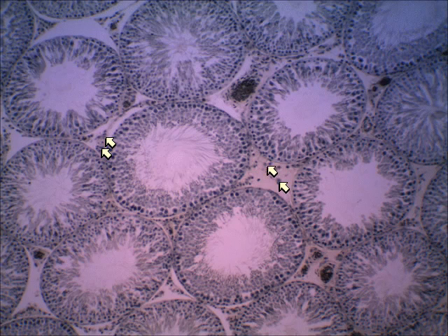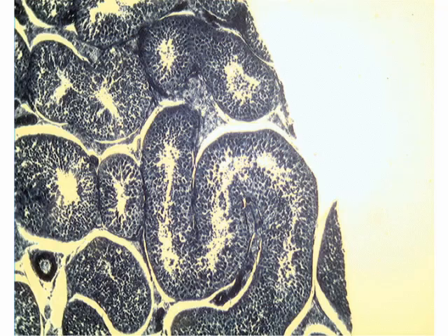In your lecture class, you learned that those cells are called interstitial cells or cells of Leydig. Those are the ones that produce testosterone. And then the spermatogenic cells are the ones of the seminiferous tubules. So it would be all of these cells. And they're in various stages of meiotic development.